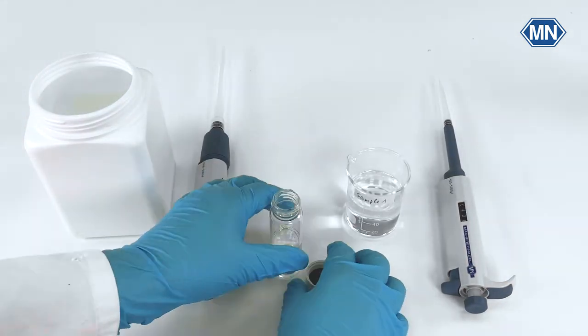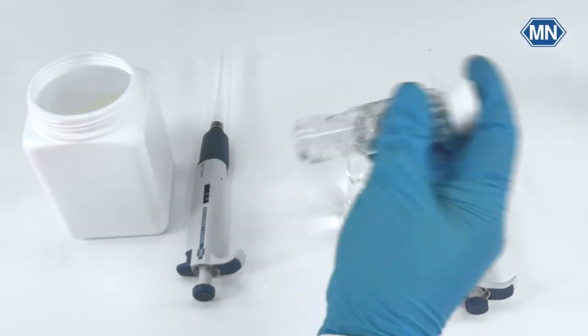Close the vessel. Shake it strongly for 30 seconds to enrich it with oxygen.